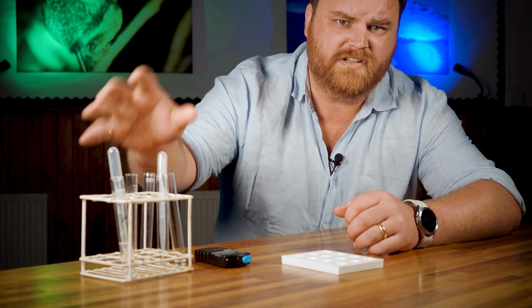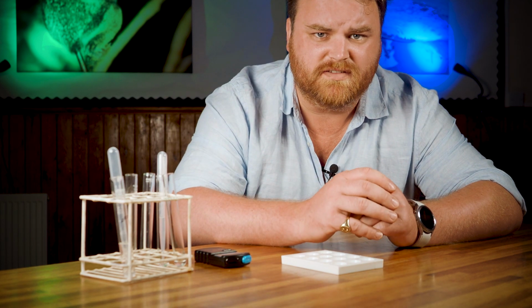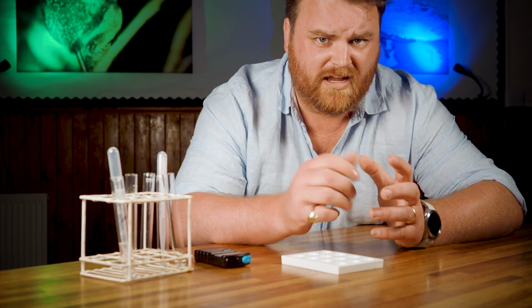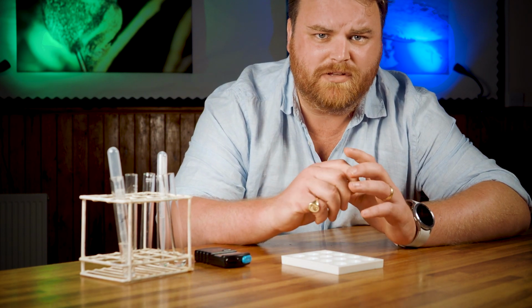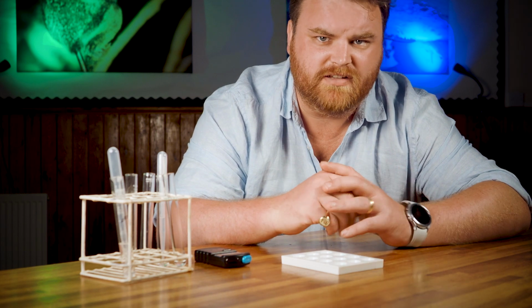So there we go. Every 10 seconds, I take a drop of the reaction mixture and place it onto the iodine to test for starch. At first, the mixture is testing positive for starch, which means the reaction hasn't finished yet. Eventually, the iodine will stop changing color, and that means all of the starch has been digested. So the faster this happens, the faster the rate of reaction.